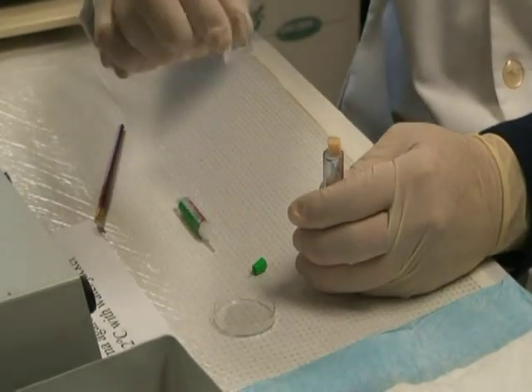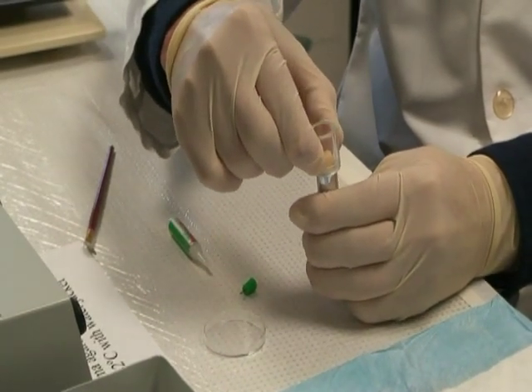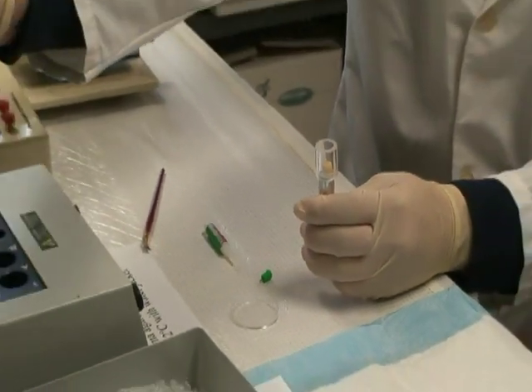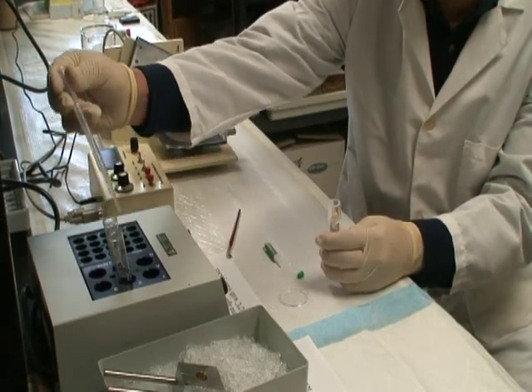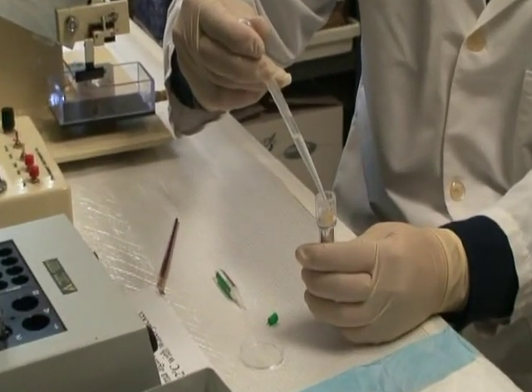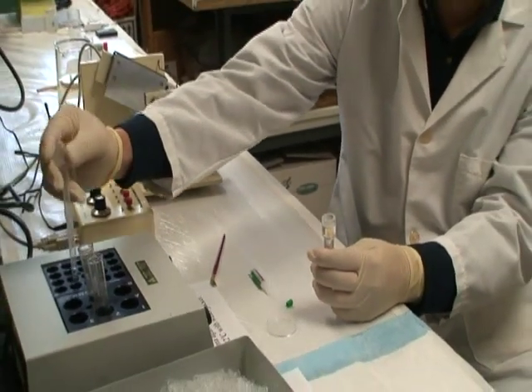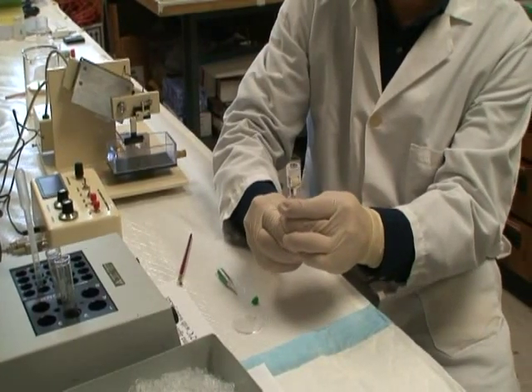Put the embedding ring on top of the specimen syringe. Pipet the agarose into the embedding ring. Draw the tissue into the specimen syringe.